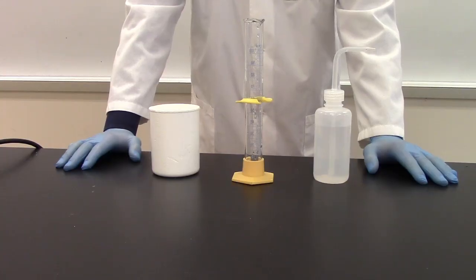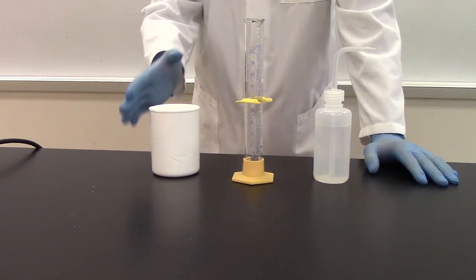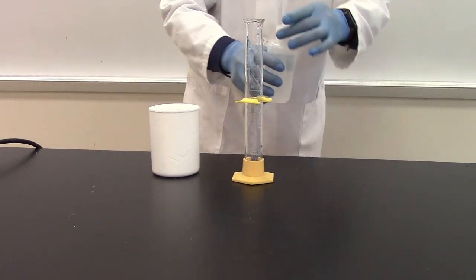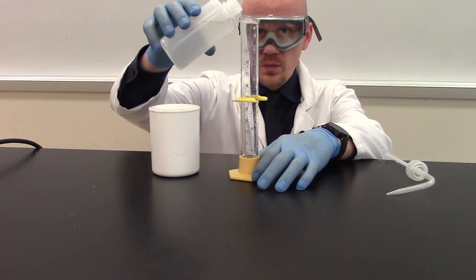While I'm waiting for the temperature of the metal to rise, I'm going to use this time to prepare my calorimeter.